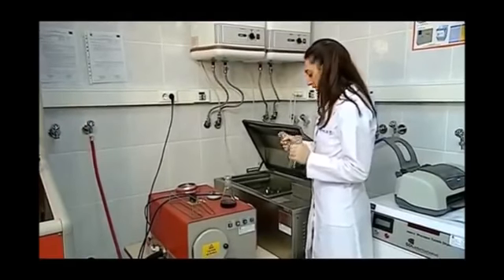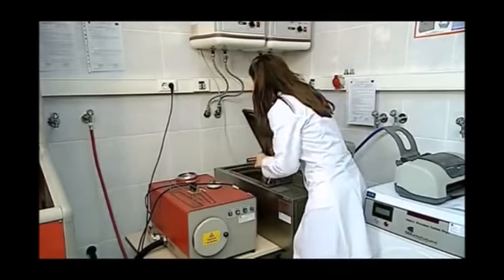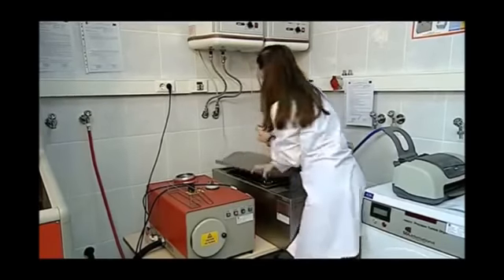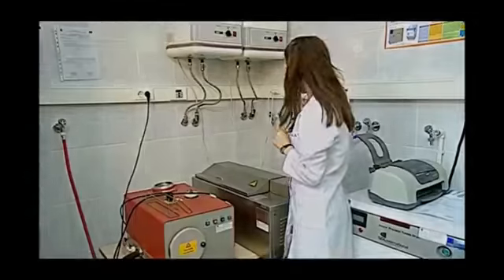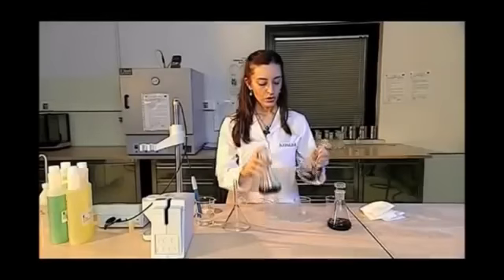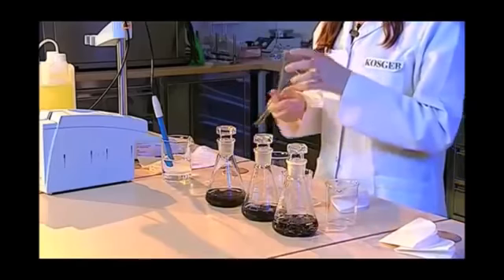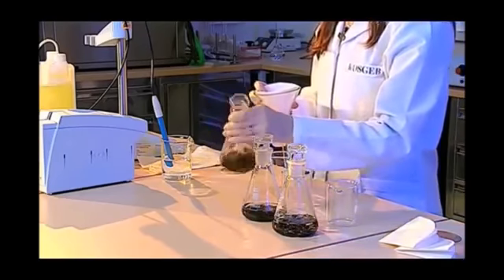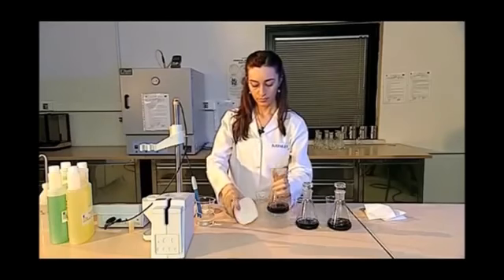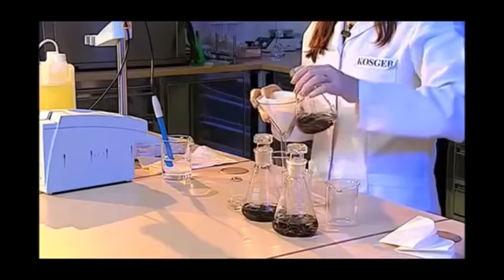Our prepared test samples are put into the mechanical beater, which moves back and forth 60 times per minute, and are shaken for 2 hours. We measure the pH values of the samples which have been taken out of the device. For this, we first apply the filtering process. We put the filter paper that we cut into the cone. We filter our sample.